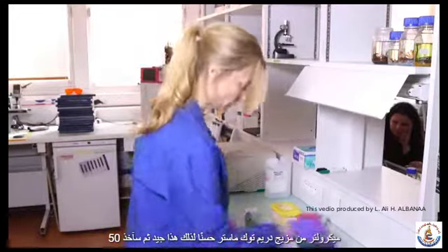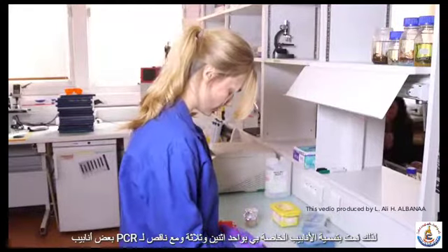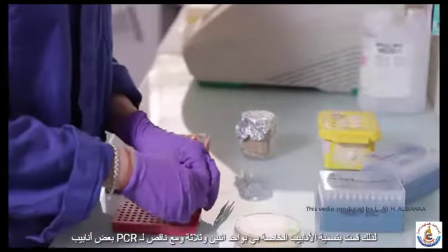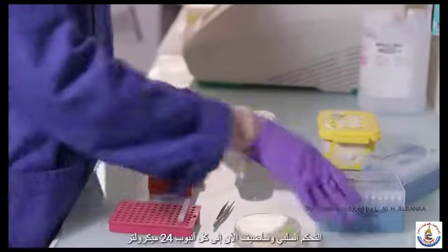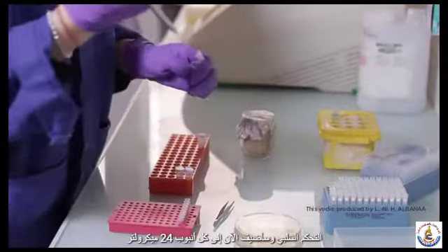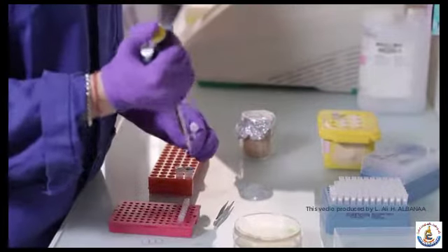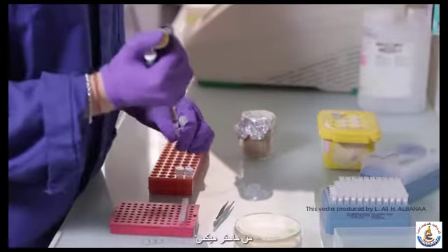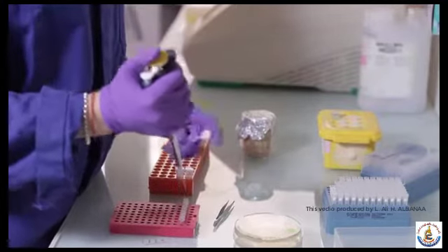So this is good. Then I'll take some PCR tubes. So I labeled my tubes with 1, 2, 3 and with a minus for the negative control, and I will now add to each tube 24 microliters of master mix.